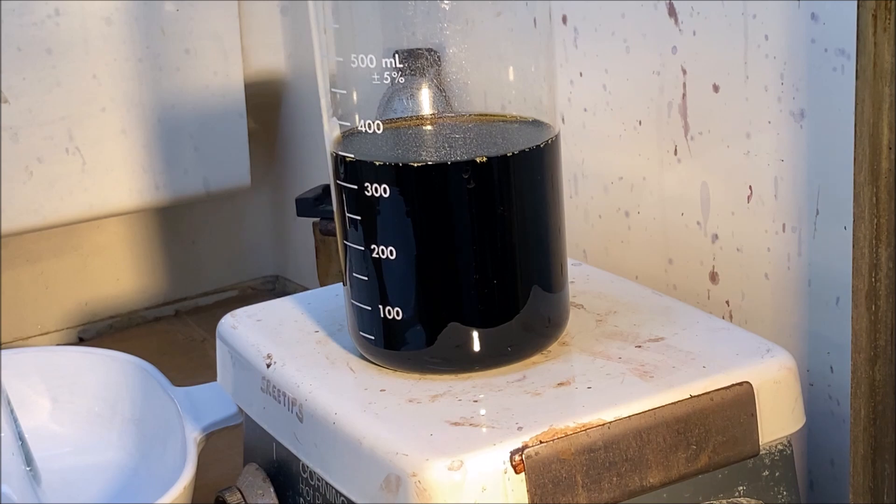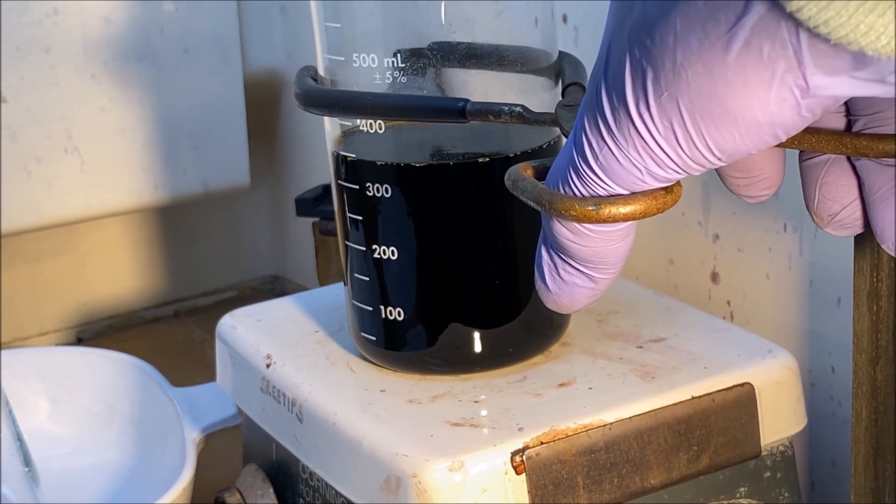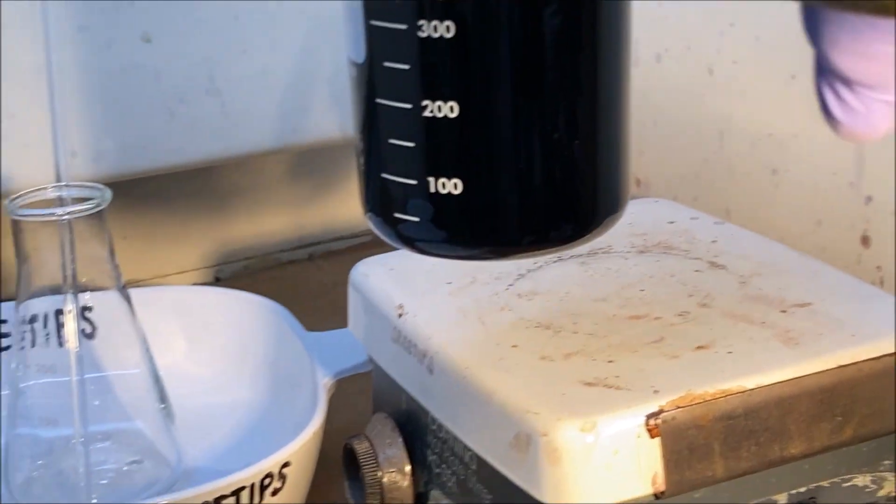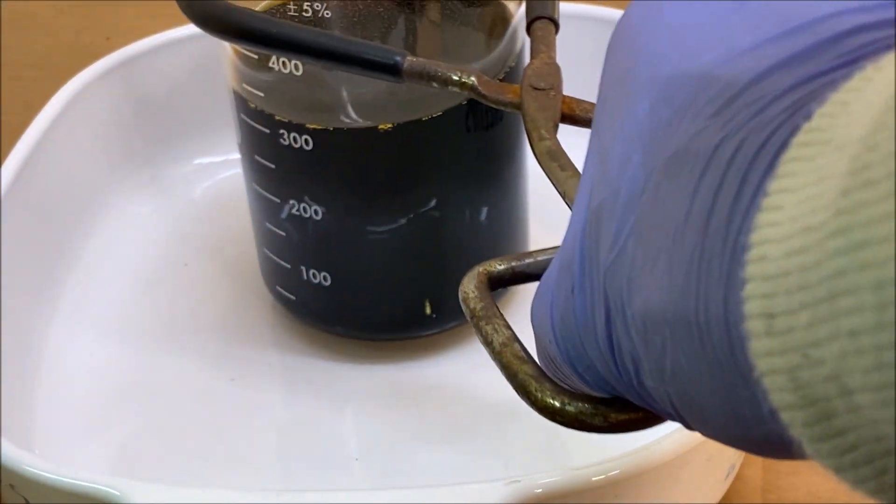Okay, I only added about 40 milliliters of that 50-50 dilute hydrochloric acid solution and I got all those crystals to redissolve. So I'm going to put it down here and we're going to let this cool off for a few minutes.